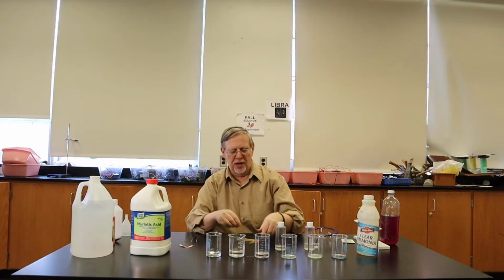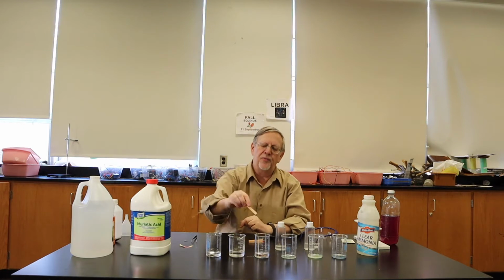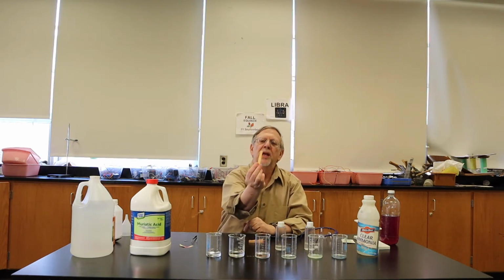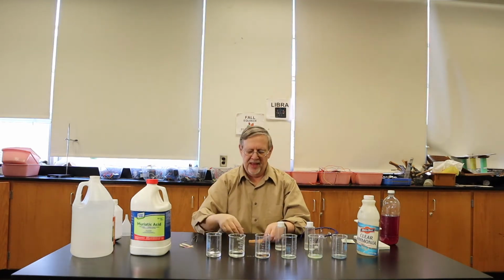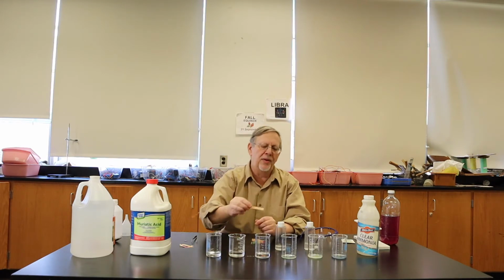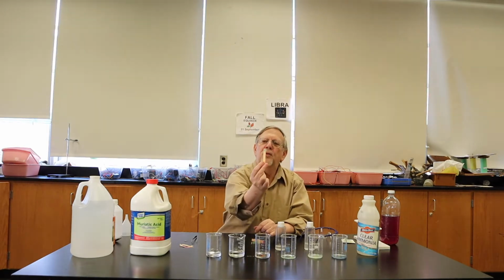Next we come to ordinary water. We put a piece of pH paper into water, and as you might have predicted, it doesn't really change much of a color at all. It sort of is turning slightly yellowish. A little hard to see. Next we come to baking soda. Baking soda is no longer in the acid range, it is in the alkali or basic range, and this time we get a light green color.